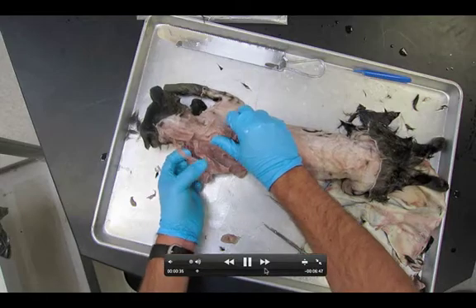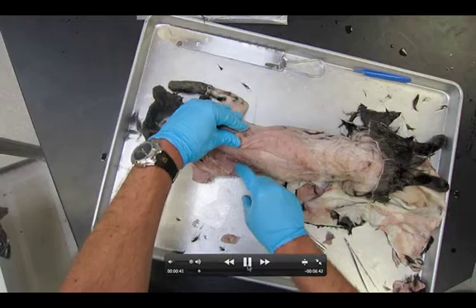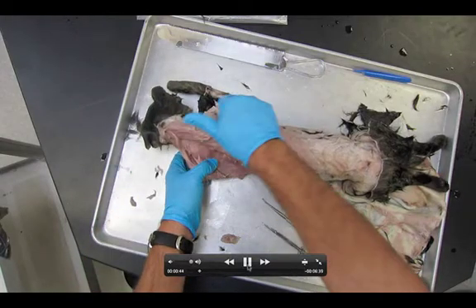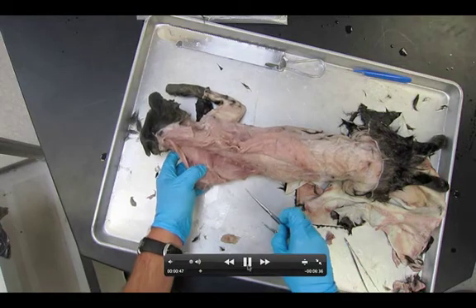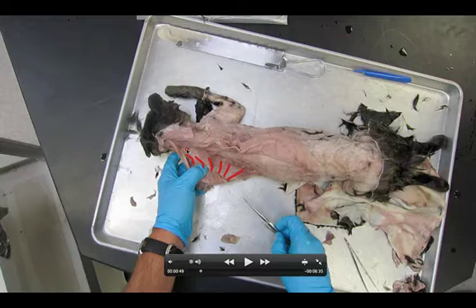With that done, the capitis is still intact — I can flip those all up. So as I look here, the muscle running in this direction — I'll highlight it all in red — this entire muscle is what we call the serratus ventralis. Not to be confused with another muscle on the wall of the cat called the serratus dorsalis. Two different muscles: serratus dorsalis and serratus ventralis. You can also see the subscapularis underneath the scapula.